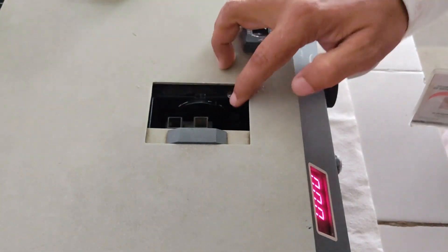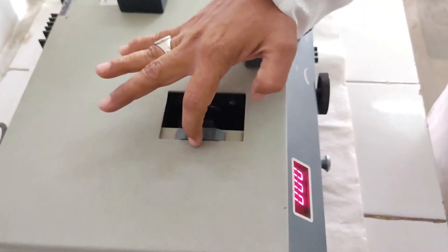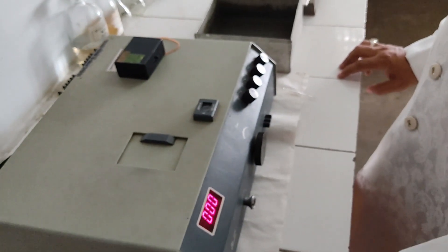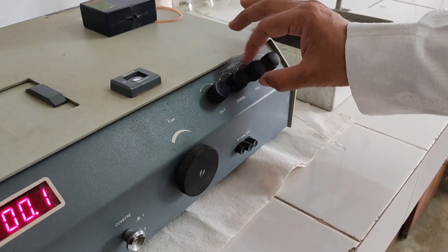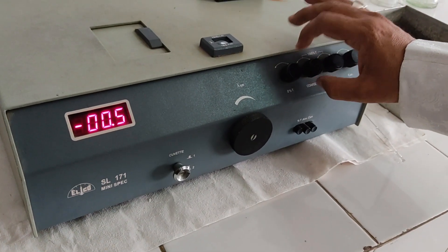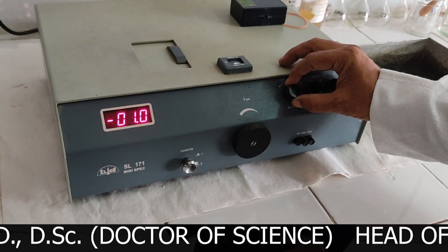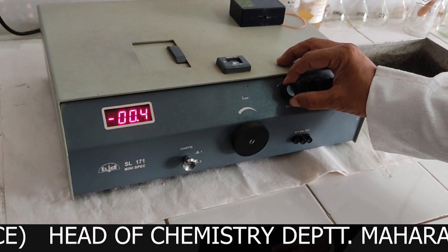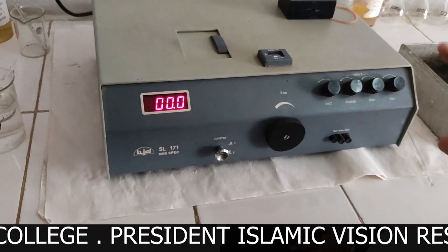Now I will rotate the sliding filter control and set it to position 1. I will close the sample compartment. I will set the percent T fine control to its maximum, and then adjust to 0% using the 0% adjustment knob. Once it is at 0%, it must not be disturbed throughout the experiment.